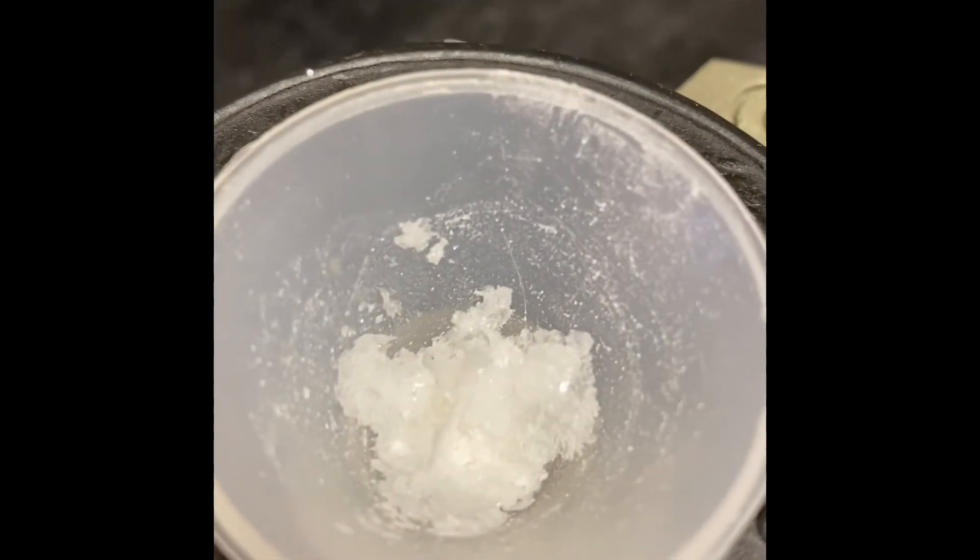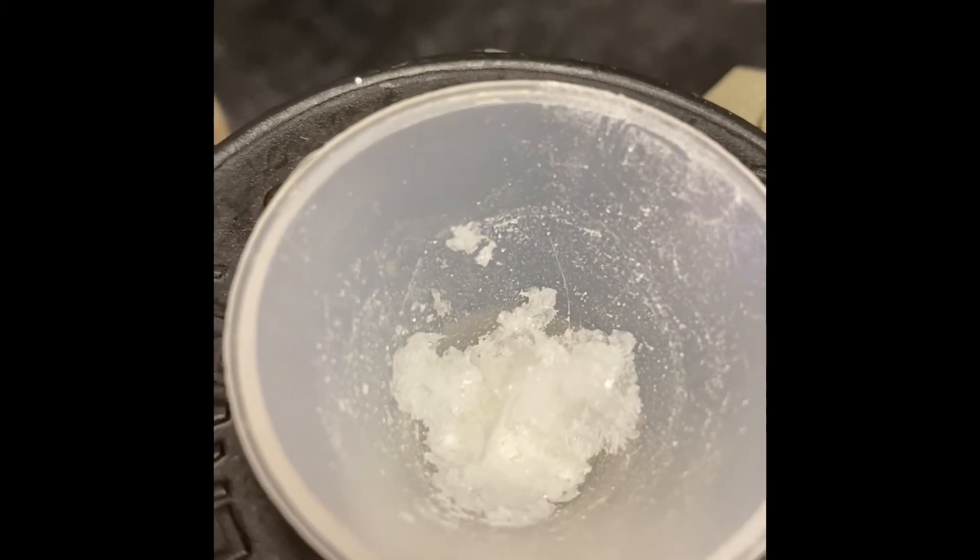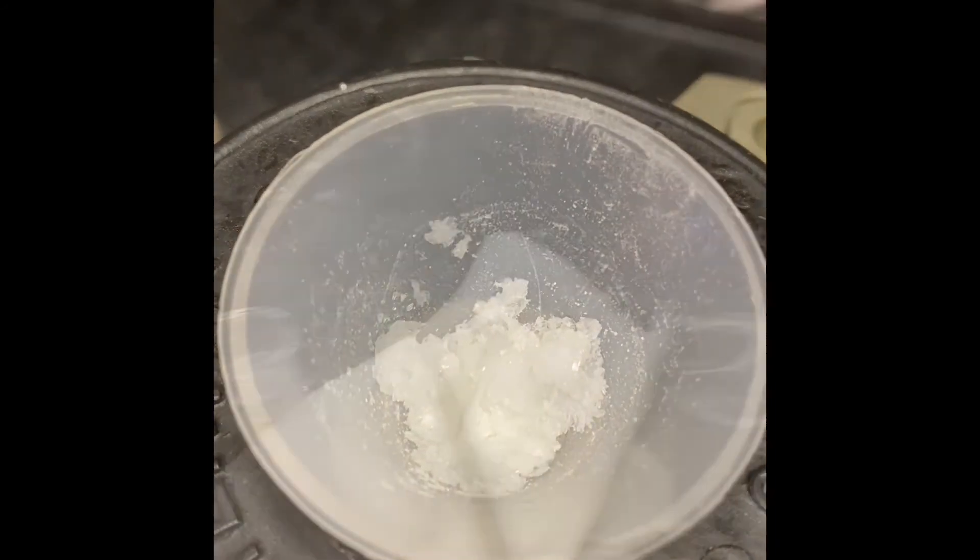After crystallization, our crystals. Now we're going to get the weight for the crystals. Let's see how much product we have. That's the product we have after crystallization. Now we're going to get the weight for it.